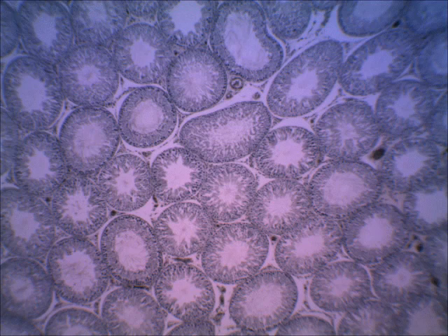So it's really important that you look in your lab book or a lecture book in the exercises or the chapter on the male reproductive system, and make sure you understand what I'm talking about when I say the lobule within the testis. In there, you see a lot of coiled up tubes that are called seminiferous tubules. And on this slide, we can see seminiferous tubules like there's one and here's one.